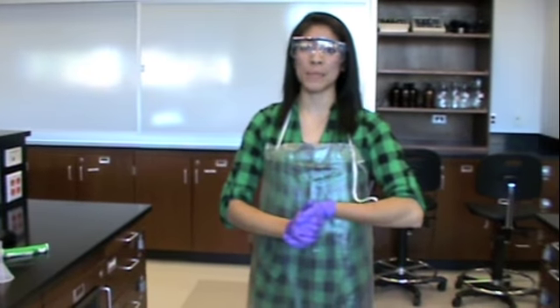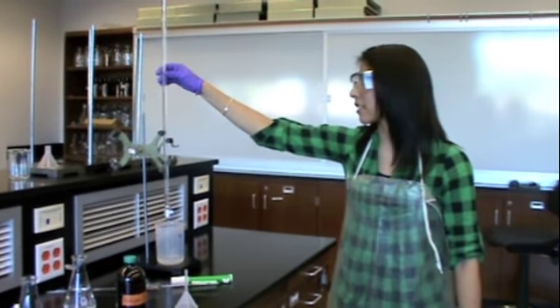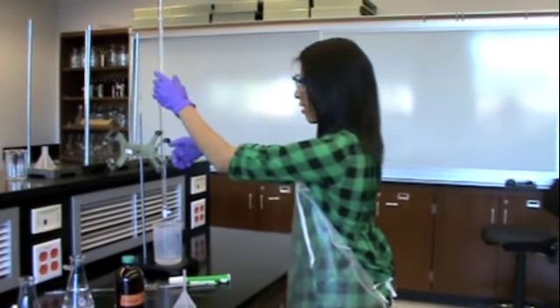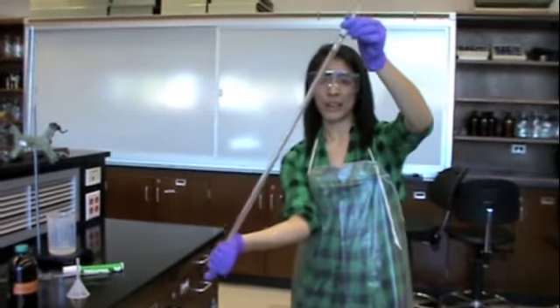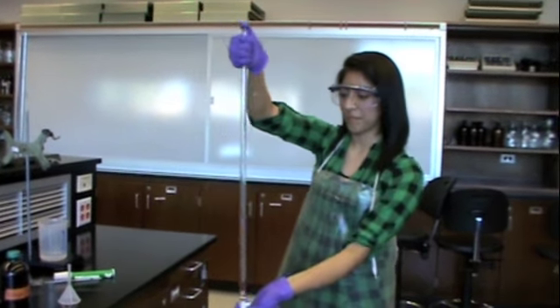Alright, so the proper steps that you should take are the following. The first thing you have to do is to make sure that your burette is clean. A burette measures precise measurements. That's why it is important that it is clean and that you rinse it with the solution that you will use, in this case, NaOH solution. So whenever you have to clean it, as stated in your manual, you have to make sure that you flip it back and forth and rinse it well.